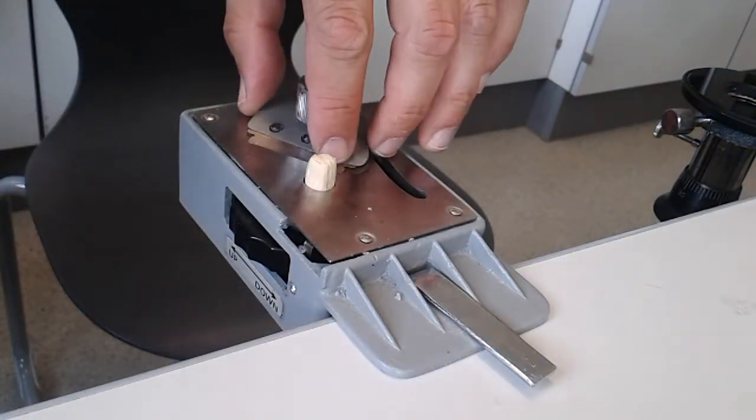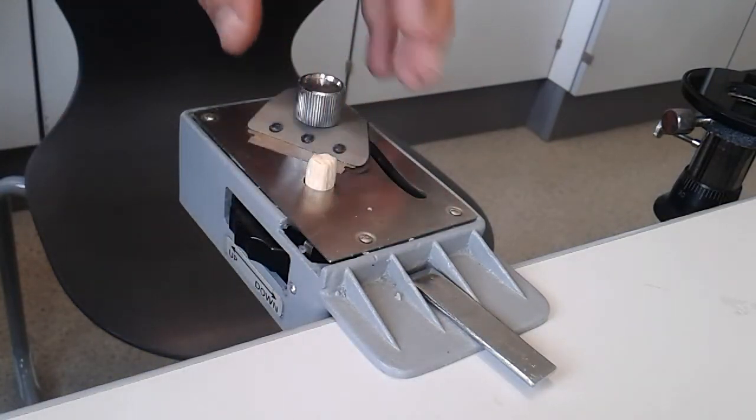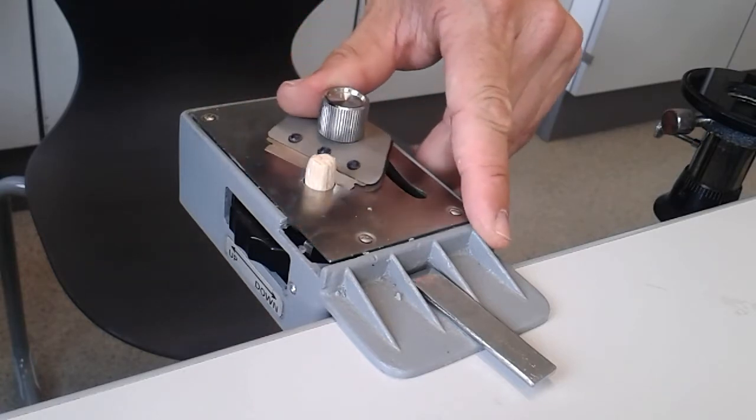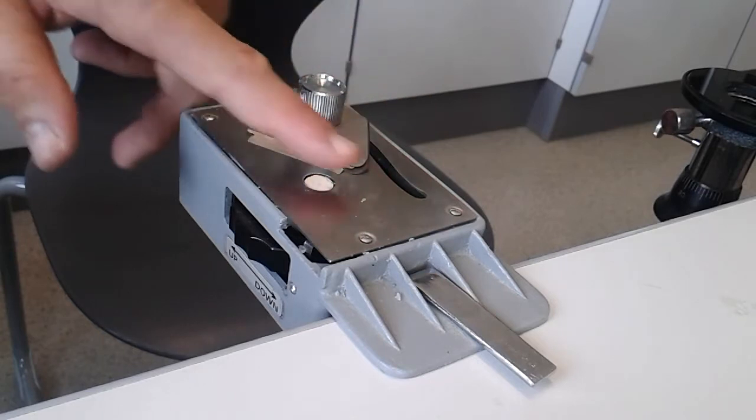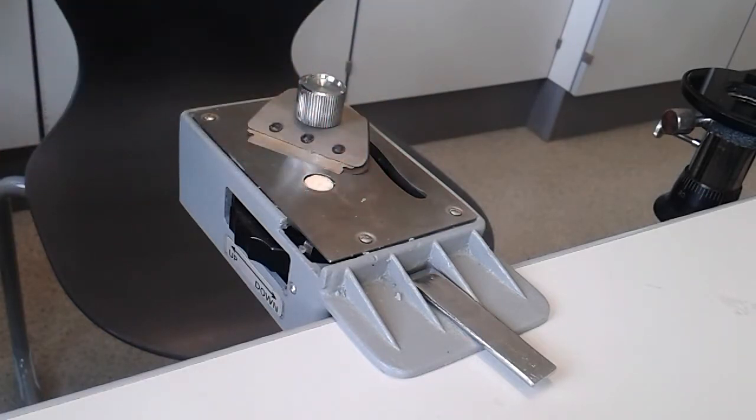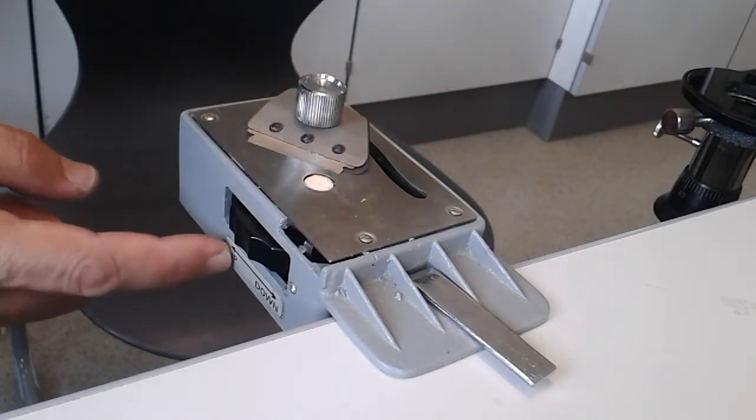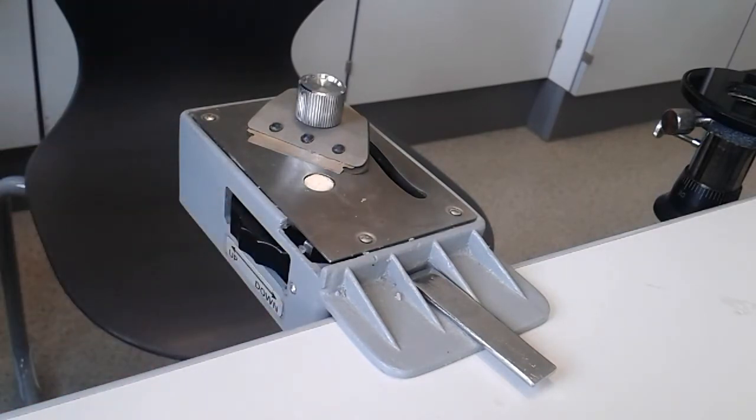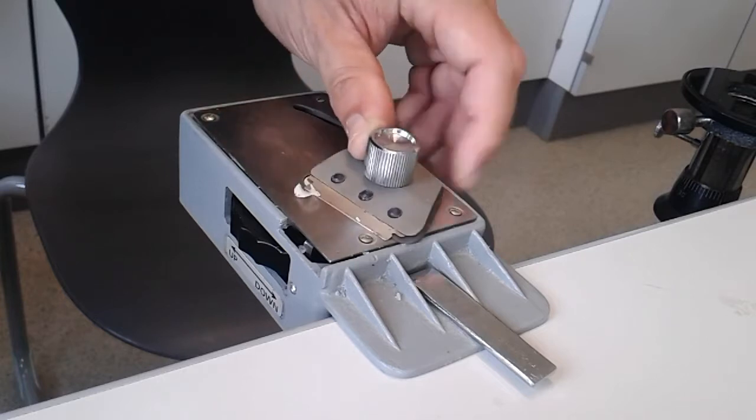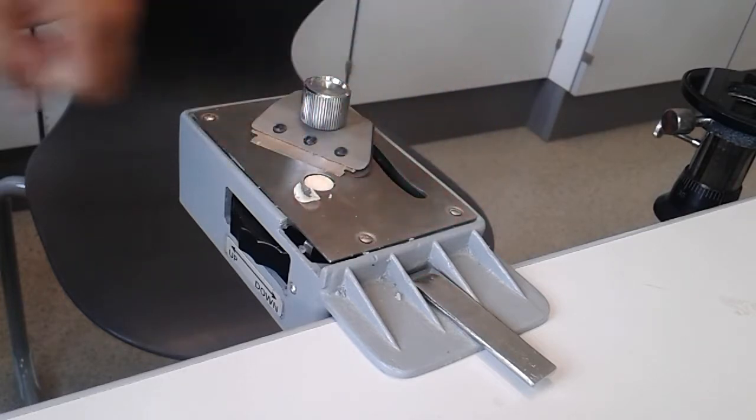At the top there is a sharp razor blade, and I can now cut it across by moving it over. It is now cut flush, but if I want to raise it a little bit, I have to turn this wheel here. It says here up and down. So I am going to turn it up a little bit, a certain amount, and then I am able to make another cut. It is not a very nice cut right now.